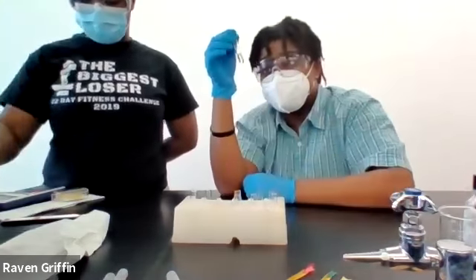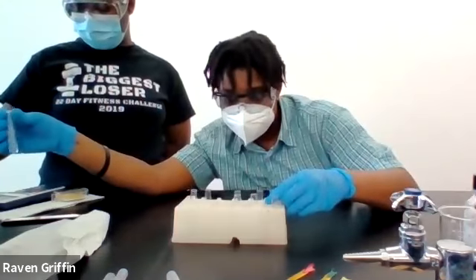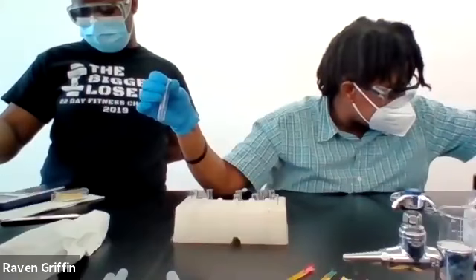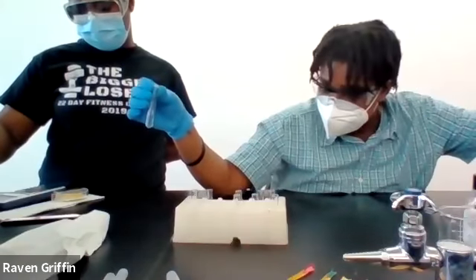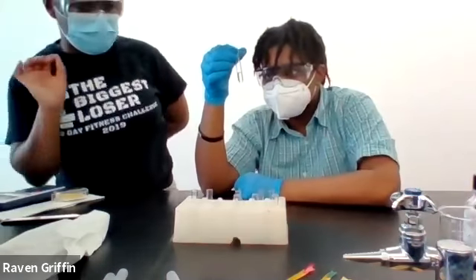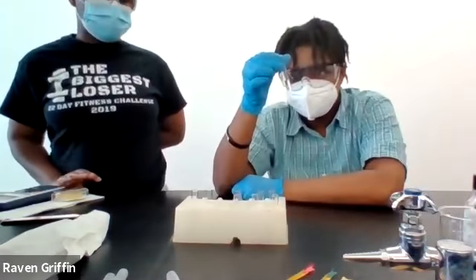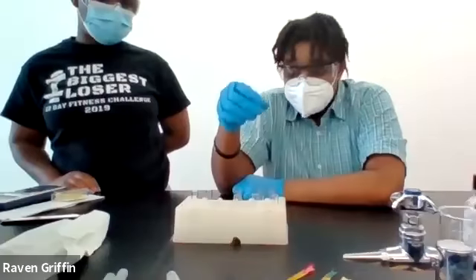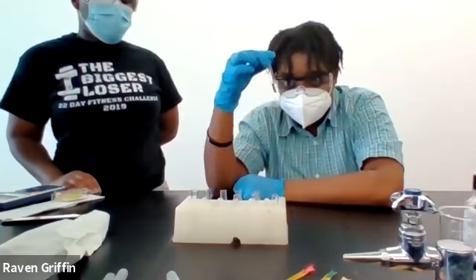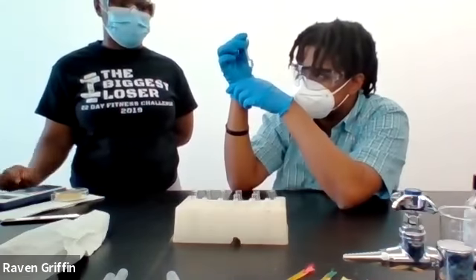This is very small. That's a hydrochloric, very little. Yeah, that would be hydrochloric. So with the 3 moles of hydrochloric, we saw a very small reaction. A few bubbles were coming off. So this reaction is going a lot slower than the other ones. Again, probably because those concentrations aren't very high.